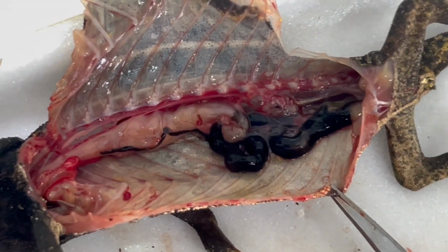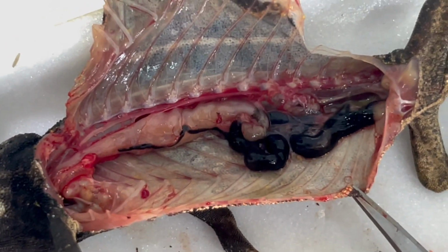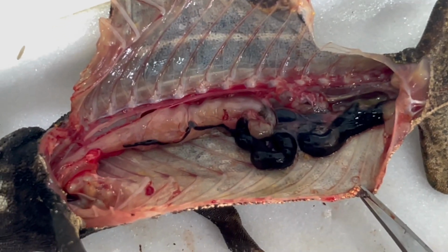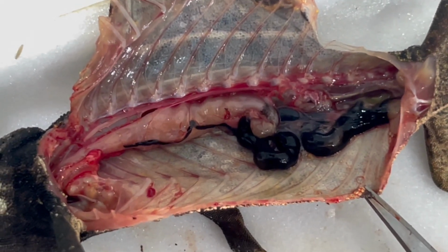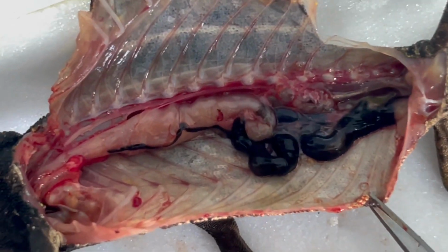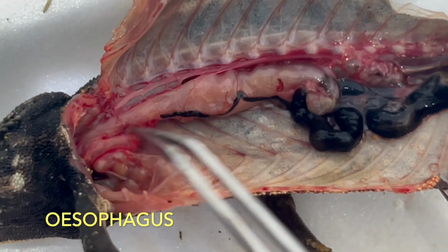So, and this topographical picture is also interesting because it shows nicely the intestine of the chameleon. The whole tract is actually very short, which is typical for chameleons. It starts here with the esophagus.